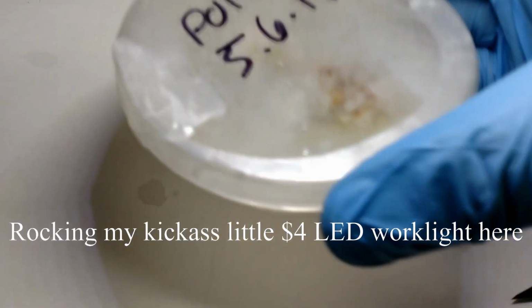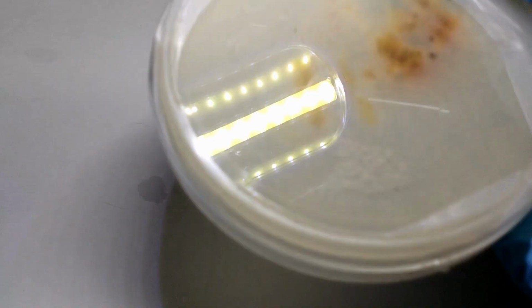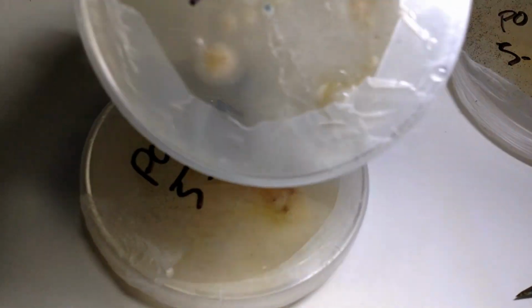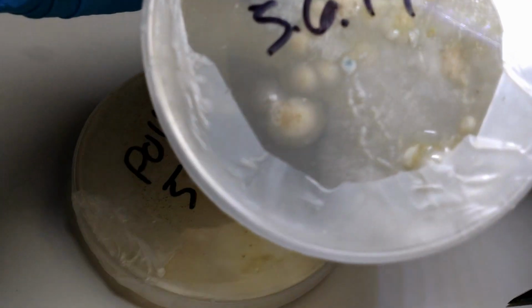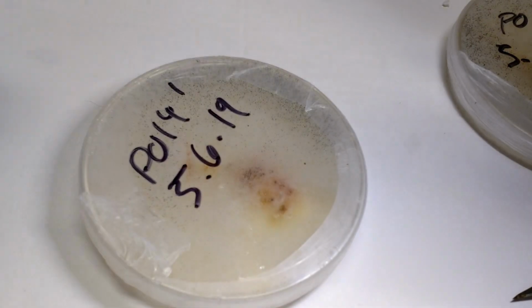Same thing here. Do not open this in front of your fan because it will blow this everywhere, and that's not what you want. But I want you to see what it looks like. If your dish looks like that, just throw it in the trash. Do not open that. That is contaminated. As is that. But sometimes you may have to.